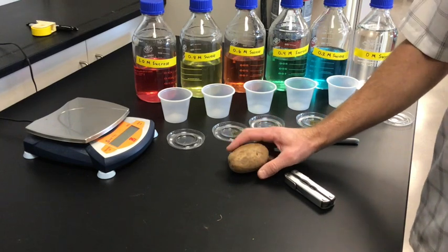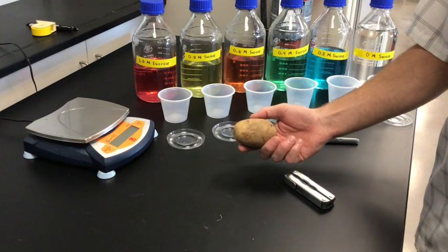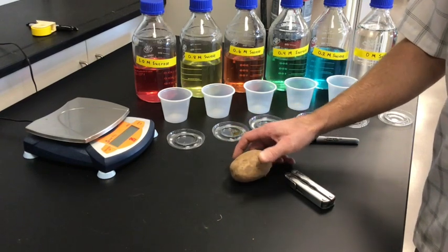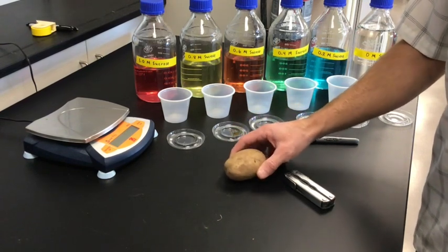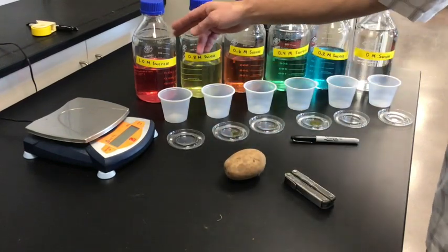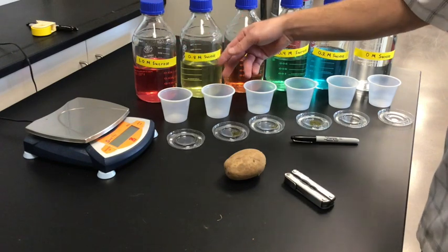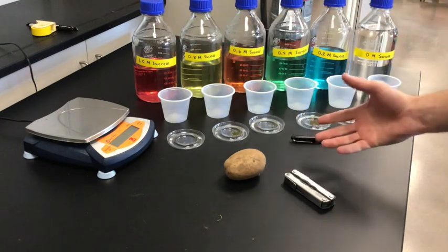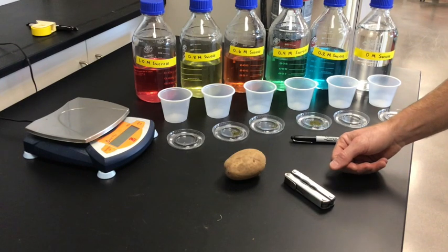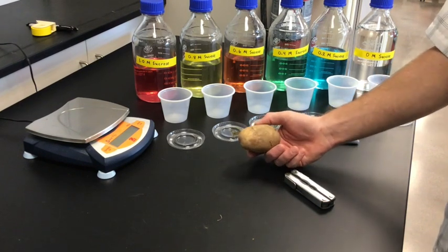We want to know what the overall concentration is of that. So we're going to take this potato, cut it up into a lot of little chunks, weigh those pieces, put them into cups, add the sucrose concentrations, and then let it sit overnight and observe the change in potato cell mass.